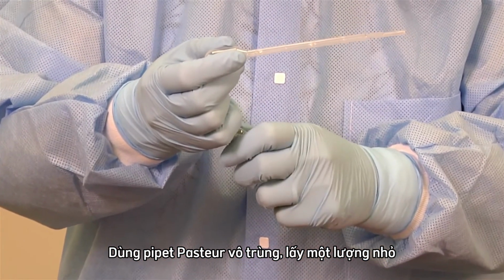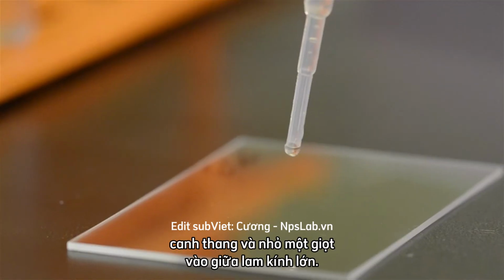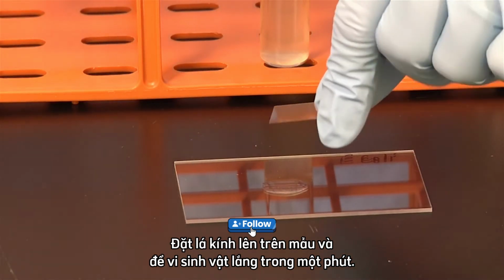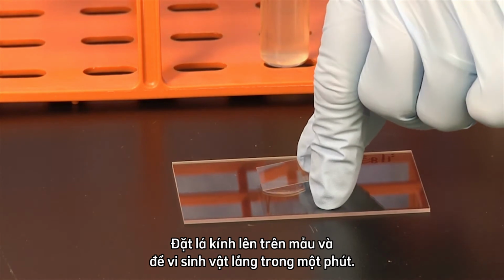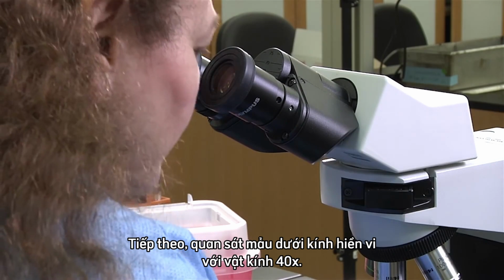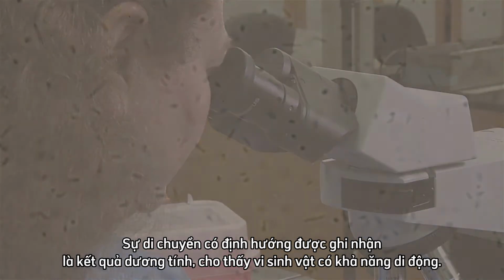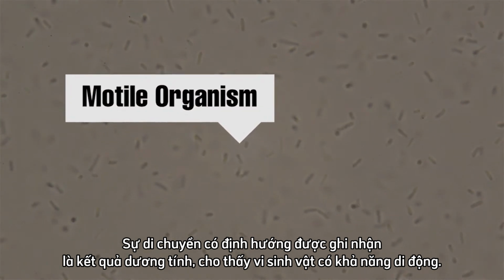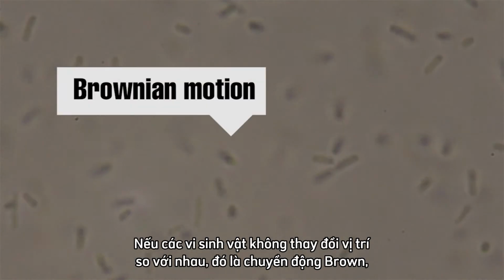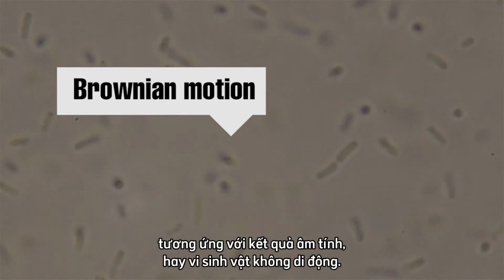Using a sterile Pasteur pipette, remove a small amount of broth and place a single drop on the center of a large glass slide. Place a glass cover slip over the sample and allow the organisms to settle for a minute. Next, observe the sample under high power, 40x, on a microscope. Directional motility is recorded as a positive test indicating a motile organism. If the organisms do not change position with respect to one another, that is Brownian motion, or a negative test or a non-motile organism.